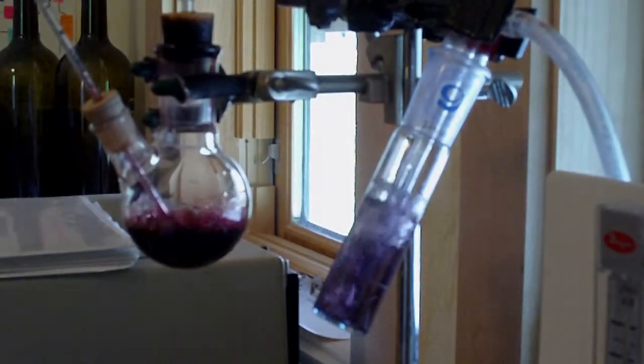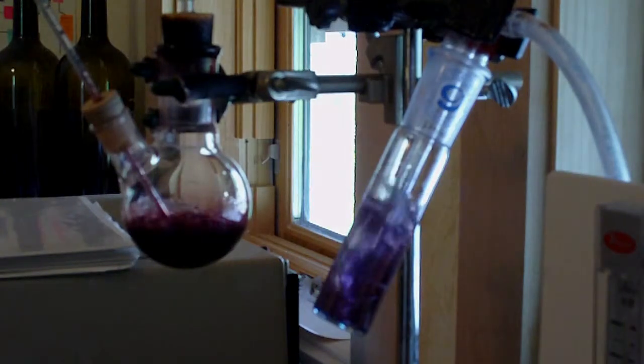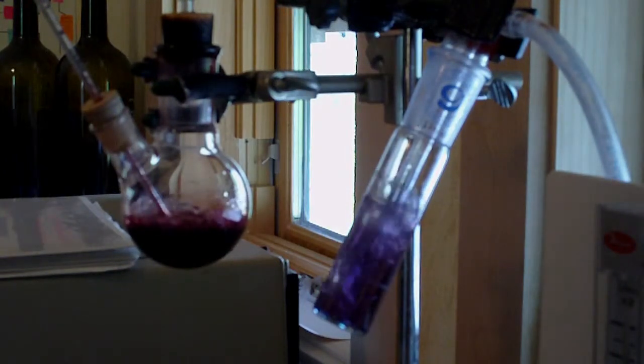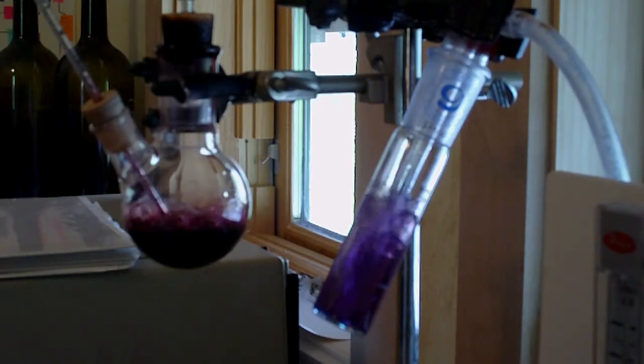I can start to see a change in color. It'll get to a pretty dark purple. The darker the purple, the more free sulfur you have in your sample.